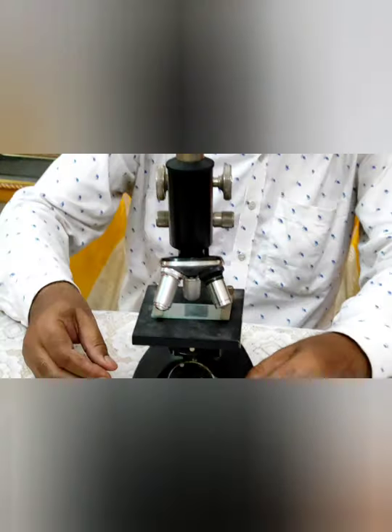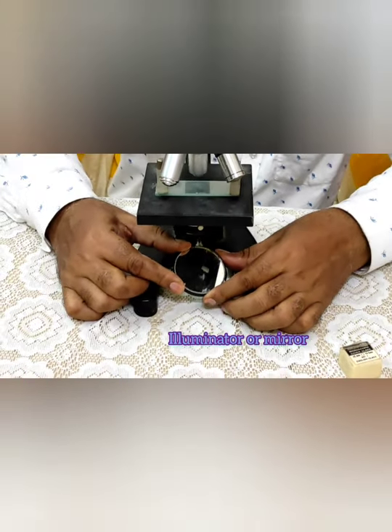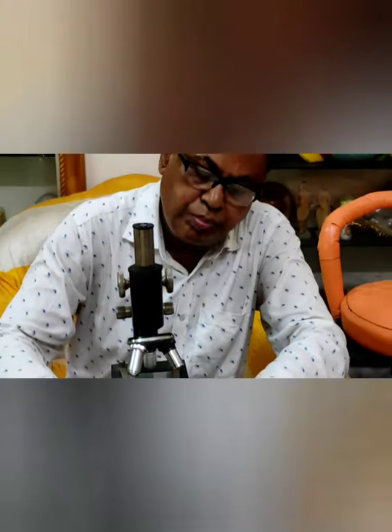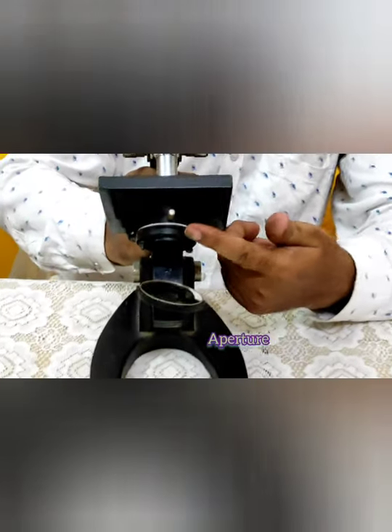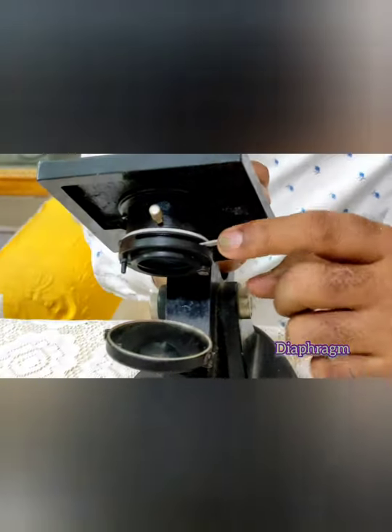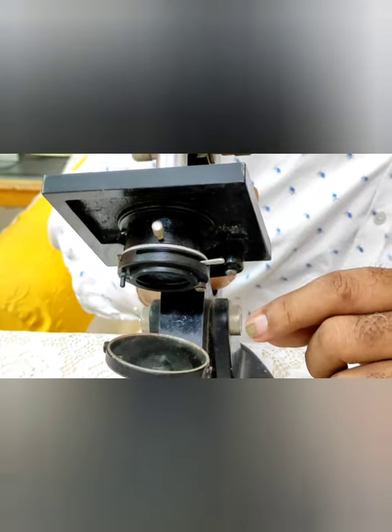Now you can see the illuminator or mirror. With the help of the mirror you can adjust the light, and this light surpasses the aperture of the microscope. Here you can see the diaphragm of the microscope, where the excessive light is cut. You can replace the mirror with artificial light.